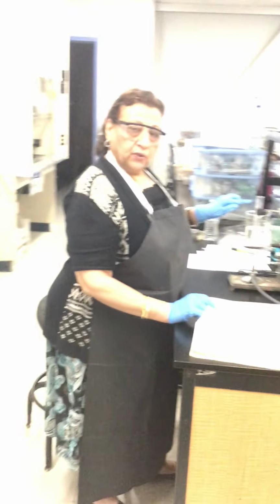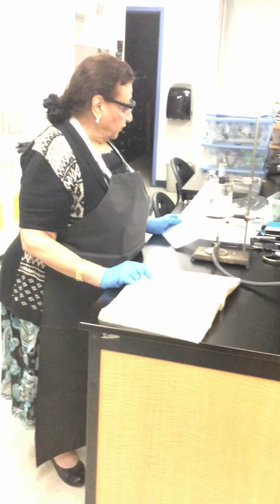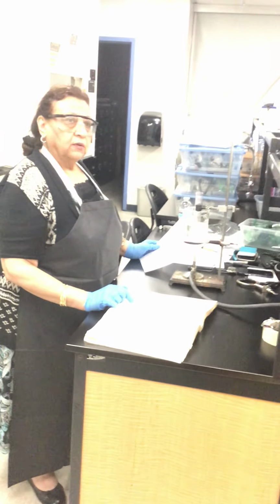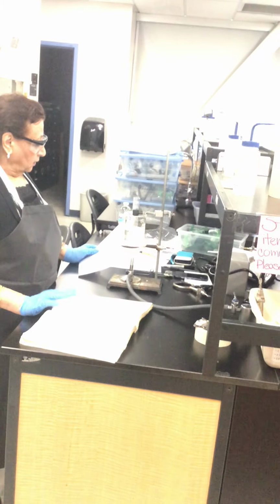So what I did here, we're doing part A, the mass of the test tube. I got the mass of the test tube and reported it here. The mass of the test tube alone is 24.42 grams. Dr. Marquez, if you want to write that.